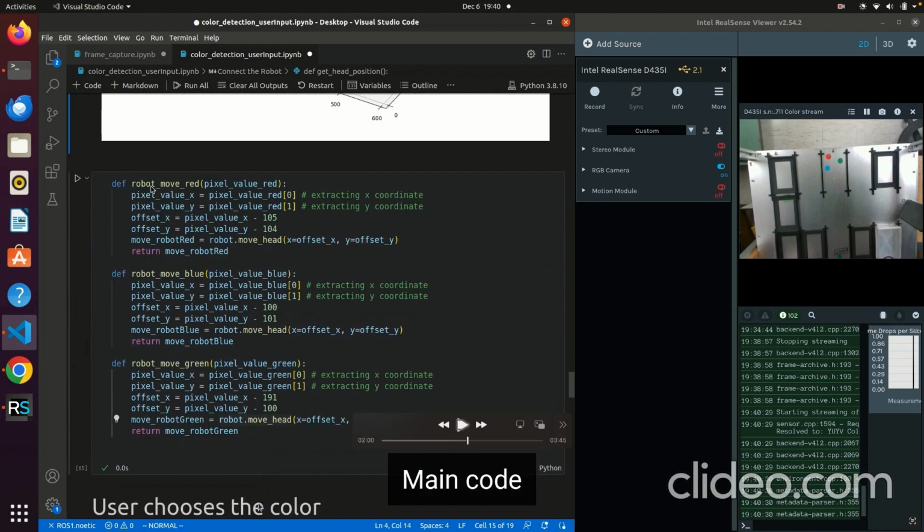And then in this function, move red, move blue, and move green, I'm extracting, from the previous function where I was returning the pixel value for red, blue, and green, the xy. You convert by giving it the offset in the robot deck, and you subtract the value by measuring the deck itself, and then you feed your offsets to move the robot. Remember, first you extract the xy values of the coordinates in the image, then you give the offset with the robot deck for red, blue, and green.